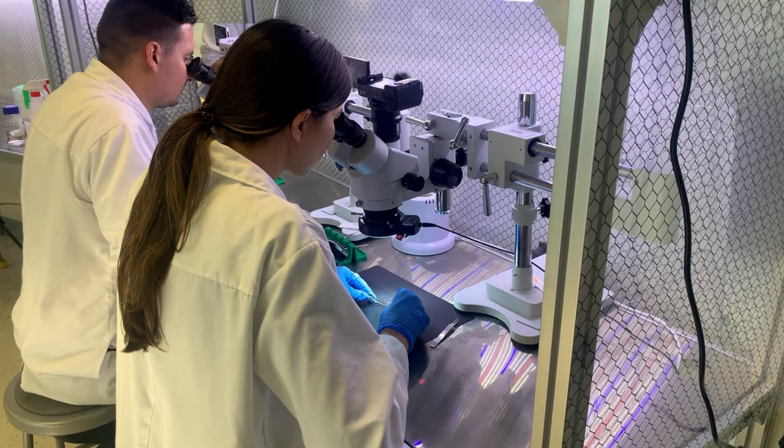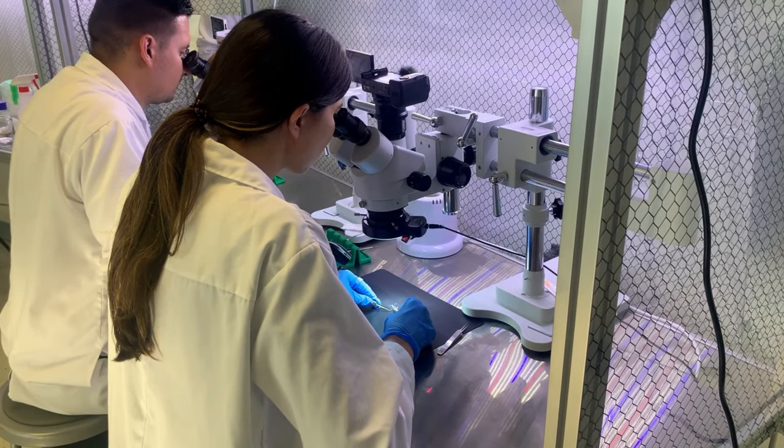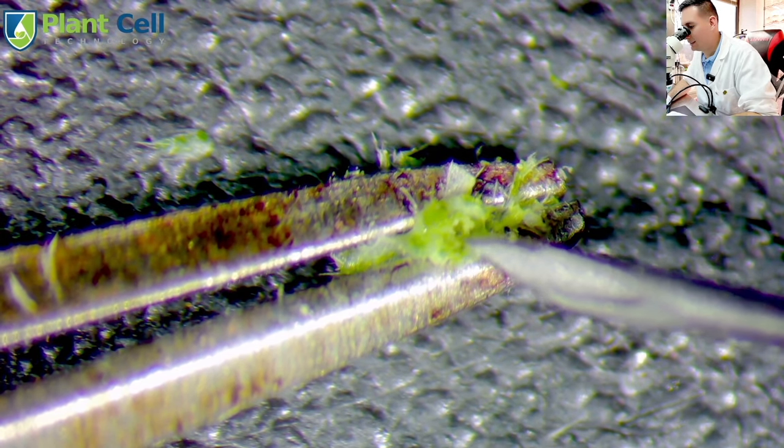HLVD, INSV, BBTV — am I speaking in tongues? Does the woman need an exorcism? No. These are all acronyms for plant viruses and viroids that have the potential to be fully eliminated from a plant's genetic line using a process called meristem culture, which I want to show you how to do today.